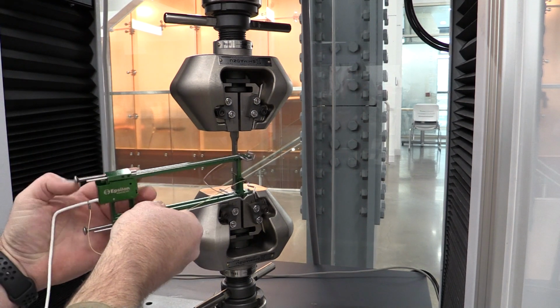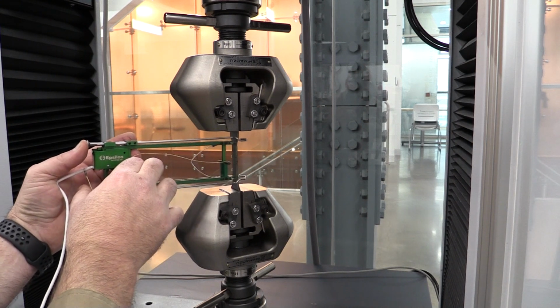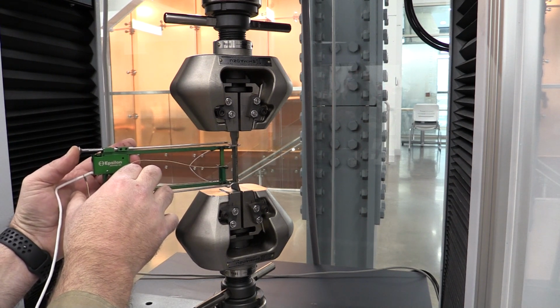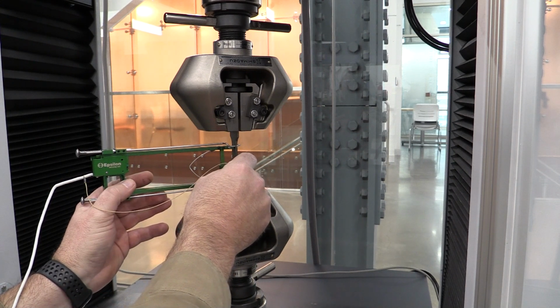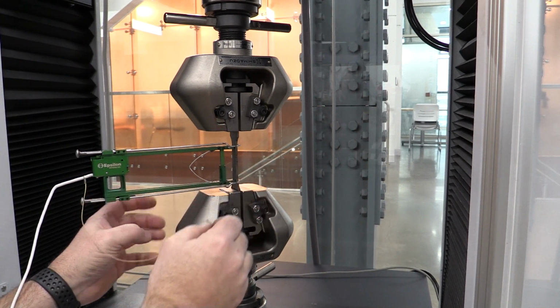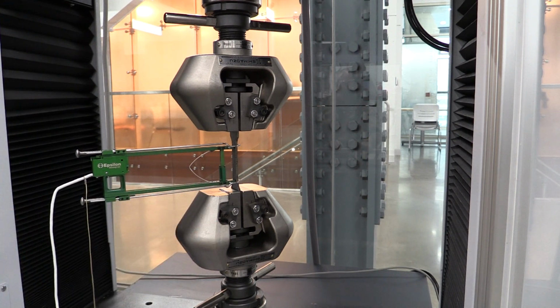The next thing we want to do is come in and put our extensometer on there. We talked about how to put that on there. I'm going to push those springs. I'm going to find where I need to put it right there. I'm going to come in here and carefully hold the other end of the extensometer, pulling that pin out, and nothing's moved. So this is armed and ready for taking our test.